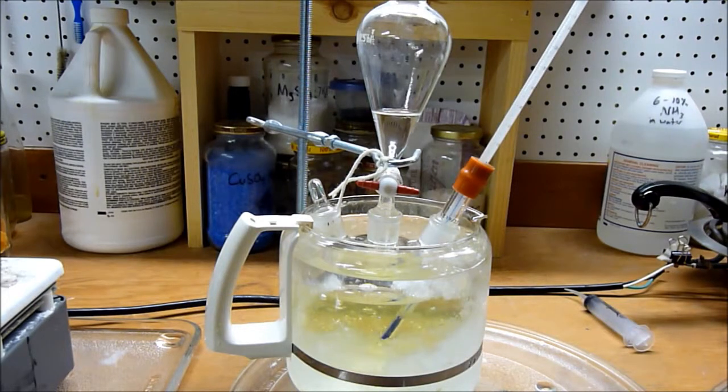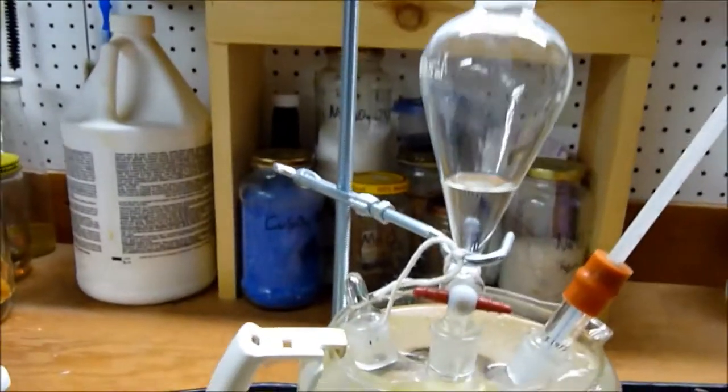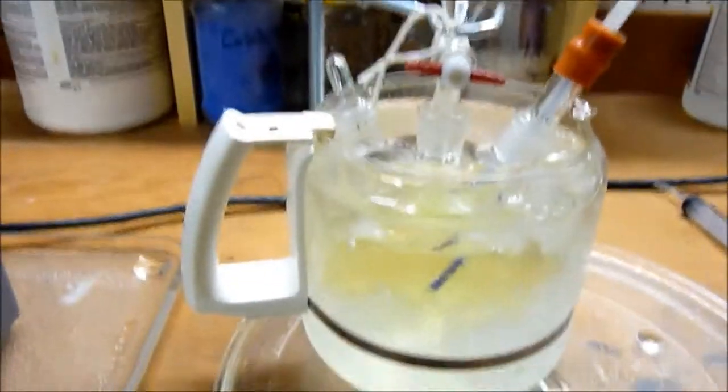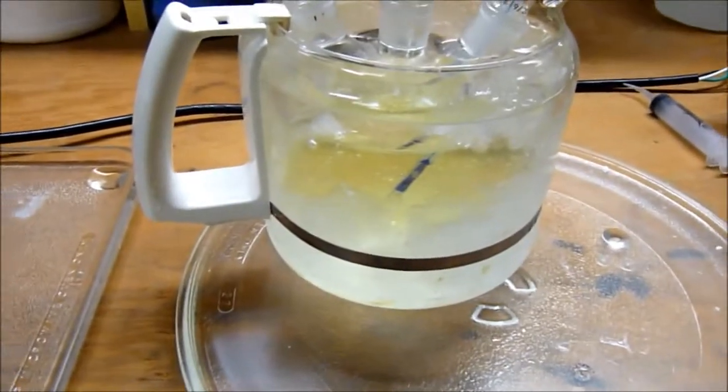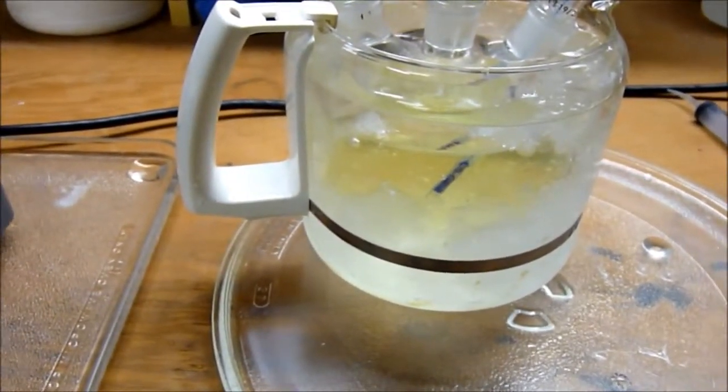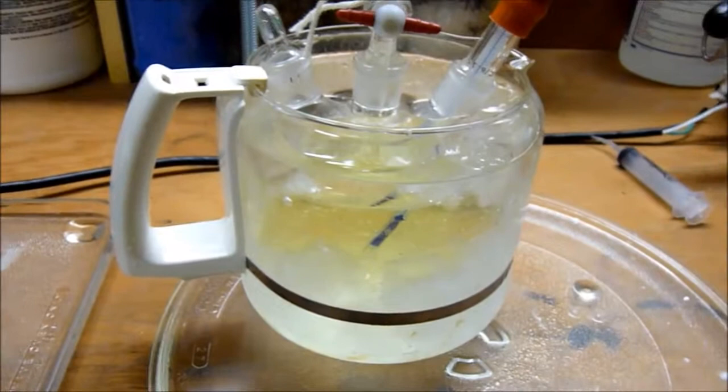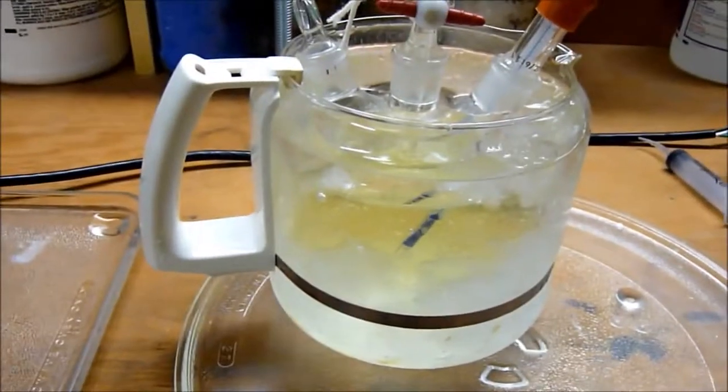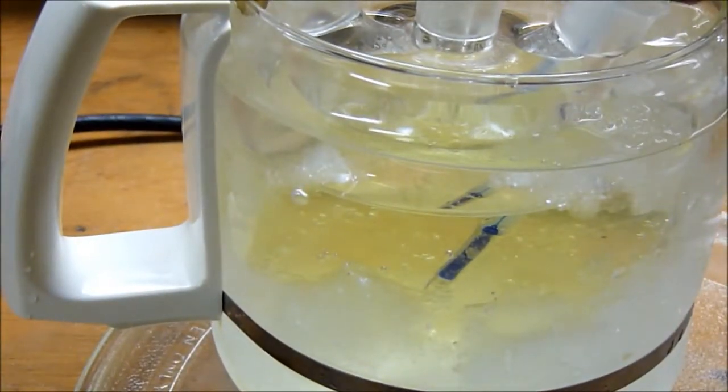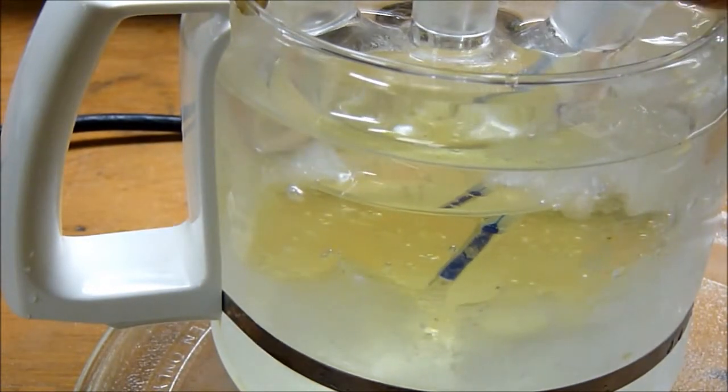If it gets above 130 degrees Fahrenheit, I'm going to have to stop it and continue at a later time once the ice bath has cooled the reaction vessel sufficiently. You'll see it become cloudy because the chloroform is insoluble. It should form a little separate layer.